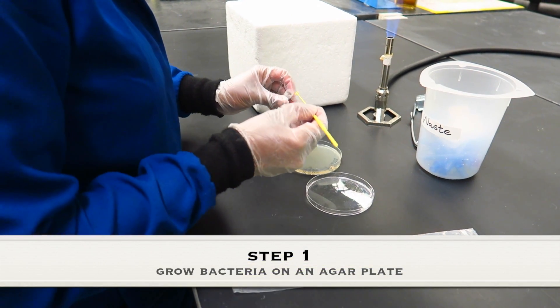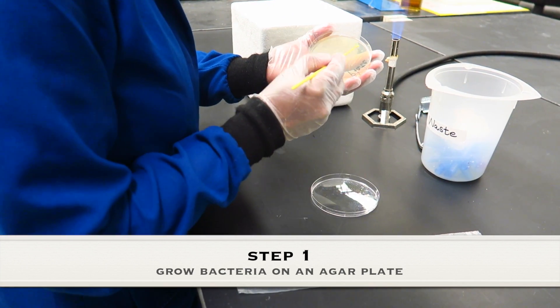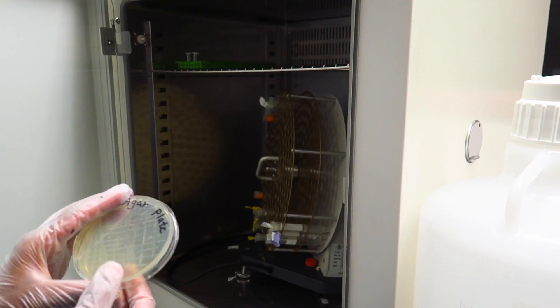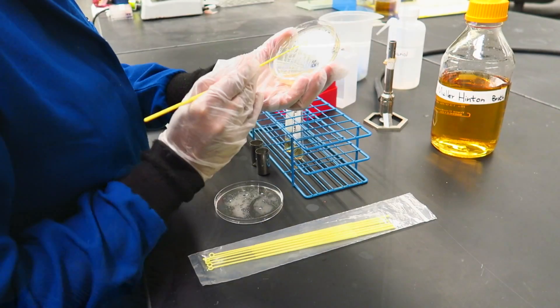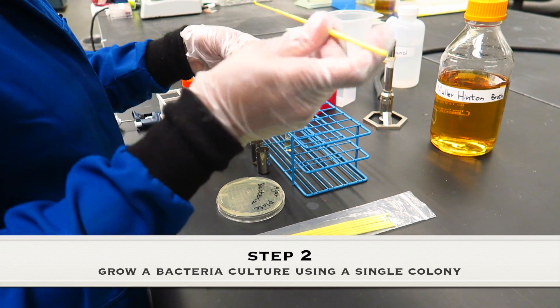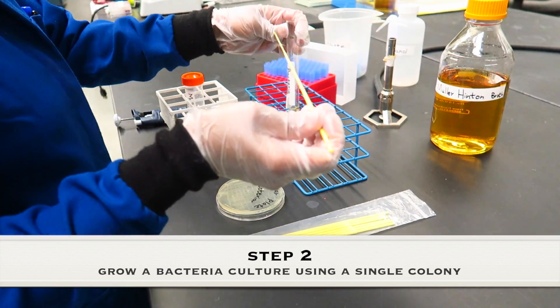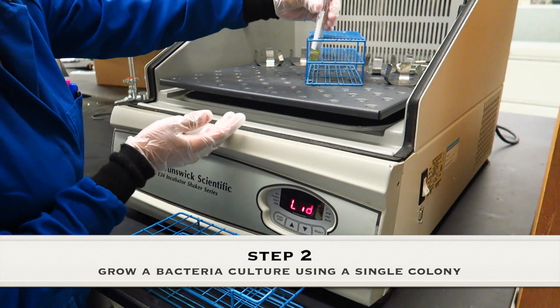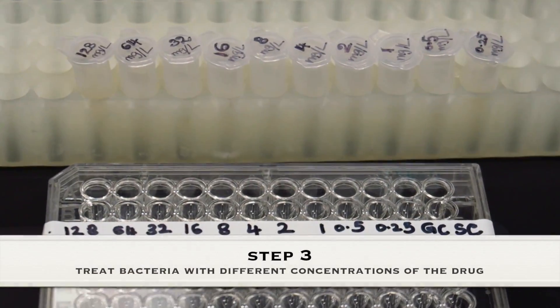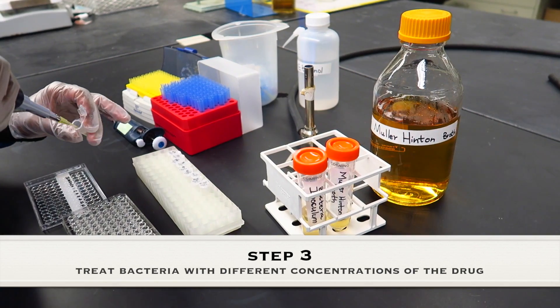First, prepare the bacteria culture in growth media. Then, bacteria are treated with different concentrations of the drug in a microwell plate.